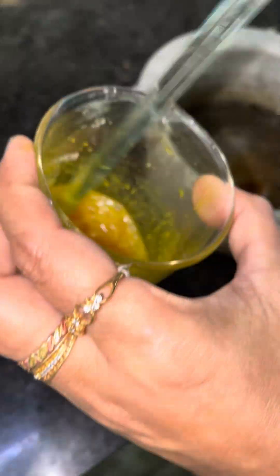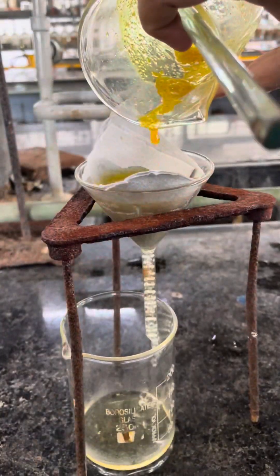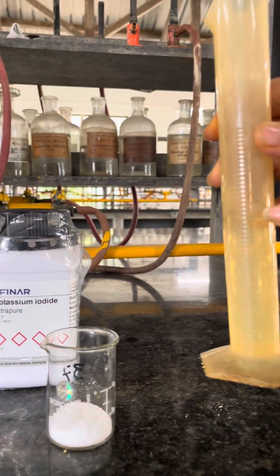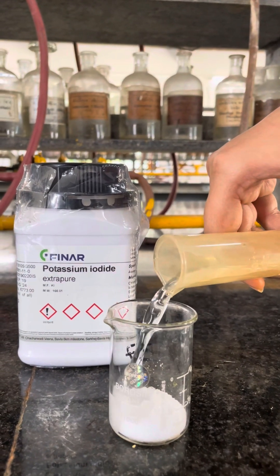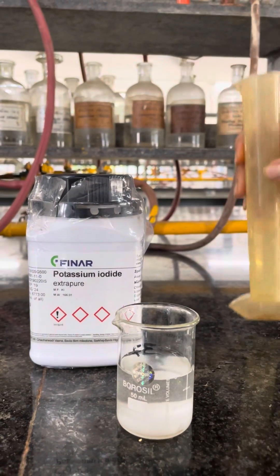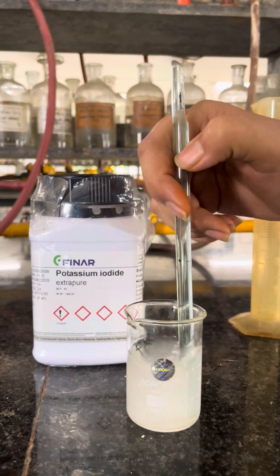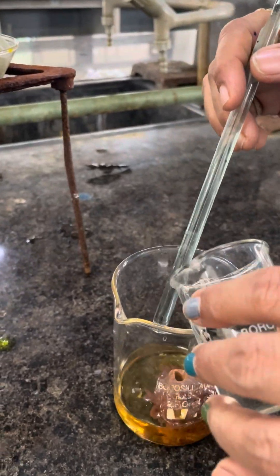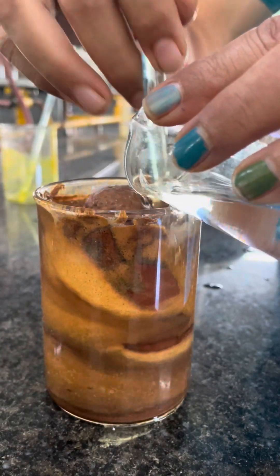Now filter the solution and discard the residue. In another beaker, prepare 10g potassium iodide solution by adding 30ml distilled water. Now add this KI solution dropwise into the filtrate. A brown precipitate is obtained.